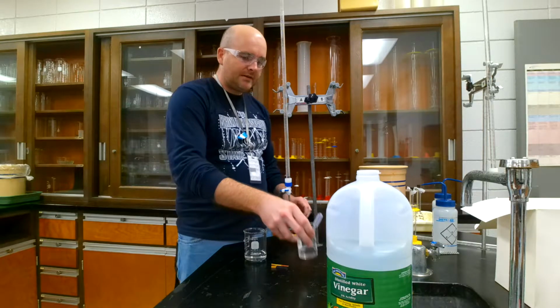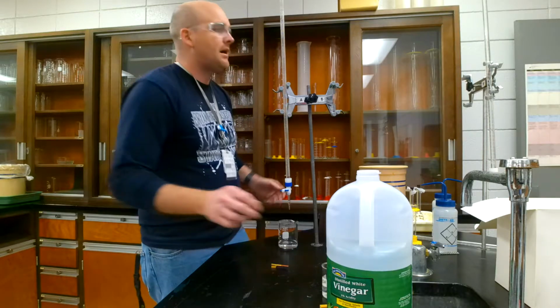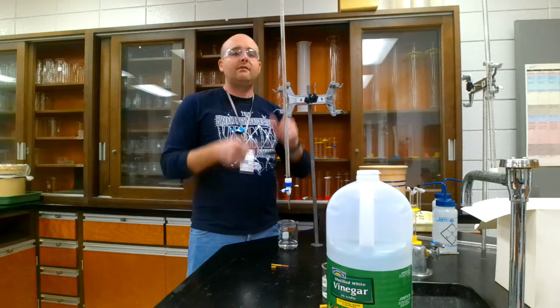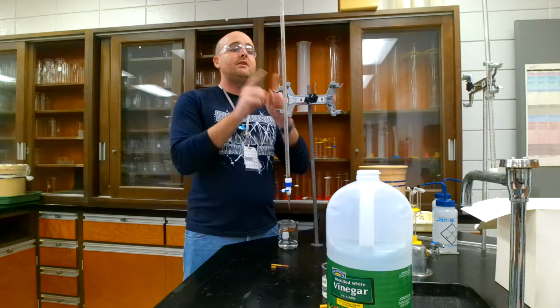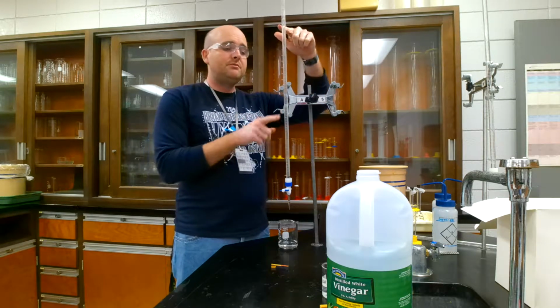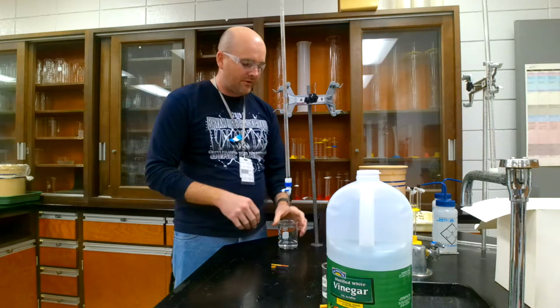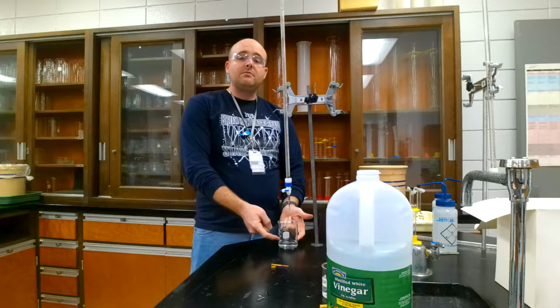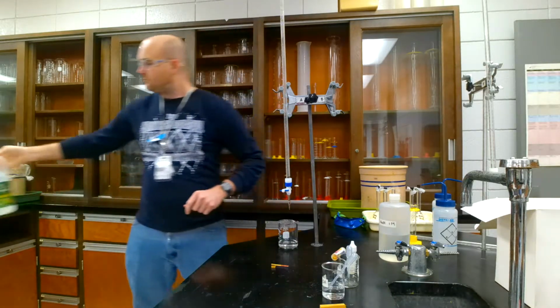So we have an acid and a base. So that's what a titration is. I know the concentration of this. This is called my titrant. A titrant has a known concentration, and we are going to measure the volume. That's why we use a burette, for a very precise volume. All I know about the vinegar is the volume here. I do not know the concentration.